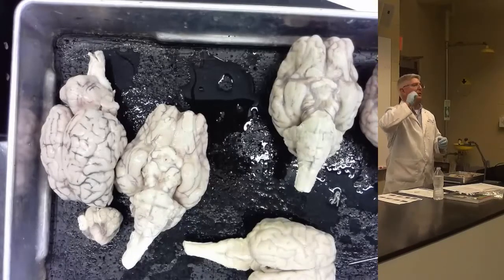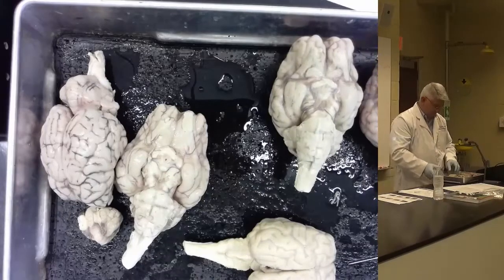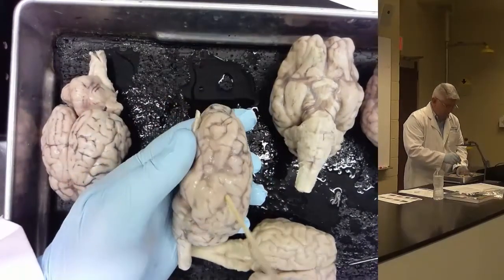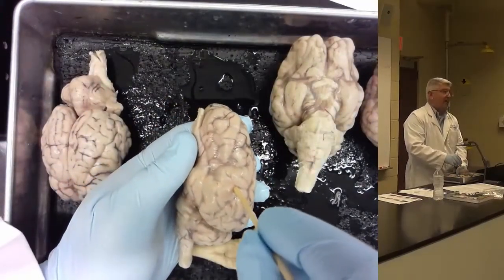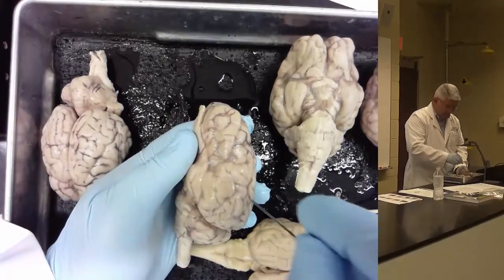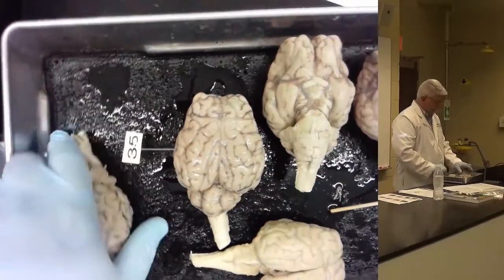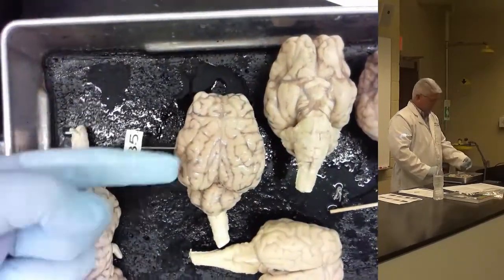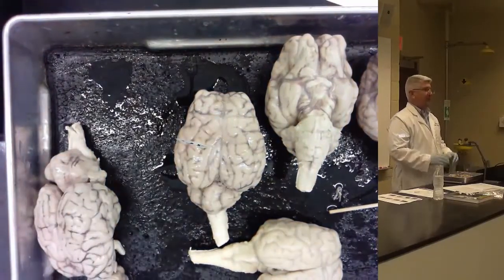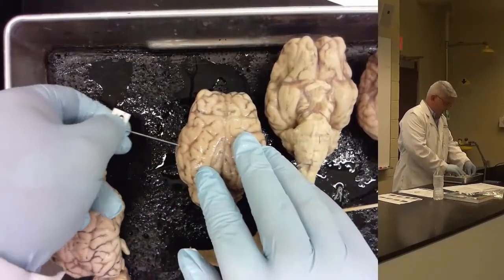Okay. Yes. Can you show the lateral fissure one more time? On the sheep brain? Yes. So the lateral fissure is going to be over here on the side, lateralmost side of the brain. And yes, you will be able to see it. It'll be marked like that. And it'll look like that in the tray because it's on the lateralmost side. Okay? Clearly different than suprasylvian. Suprasylvian's way up on the top part. Lateral way down here. Okay?